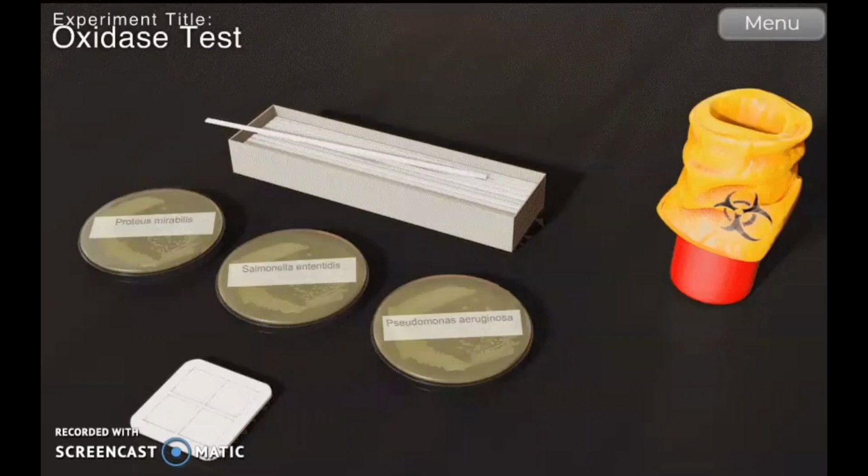respiration. This does not mean that they are strict aerobes. Bacteria that are oxidase negative might be anaerobic, aerobic or facultative. The oxidase negative result just means that these organisms do not have the cytochrome c oxidase that oxidizes the test reagent.